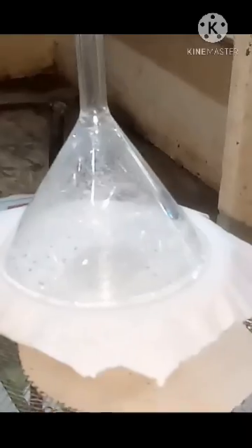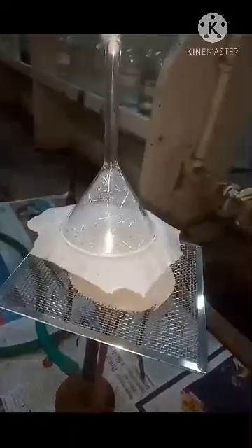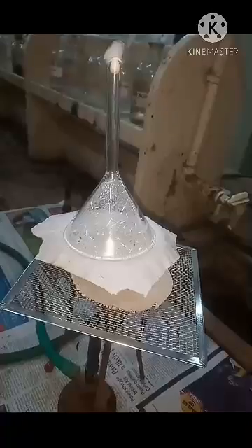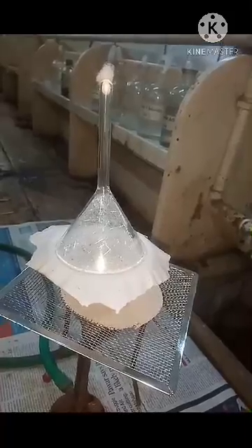Now you are able to see fine needle-shaped crystals are forming. Now you can see the filter paper has become dry again. We have to stop heating, so put off the burner. Let it cool down for at least 10 minutes because slow cooling is also required for crystal formation. Slow cooling is important.